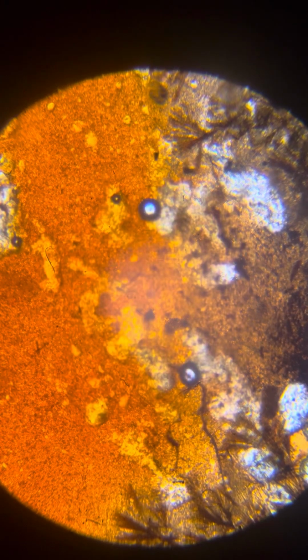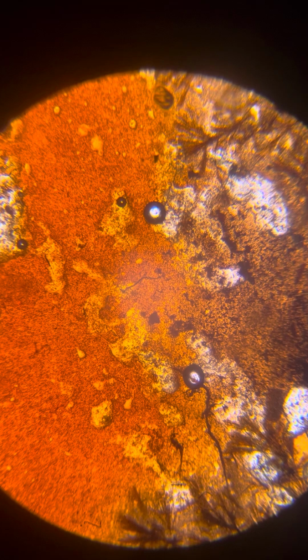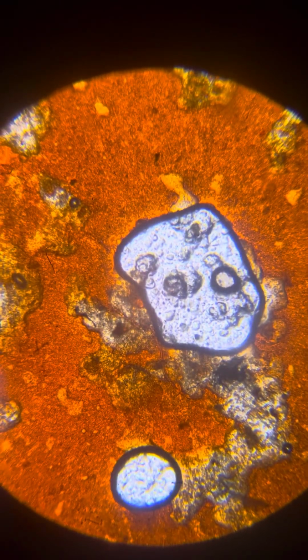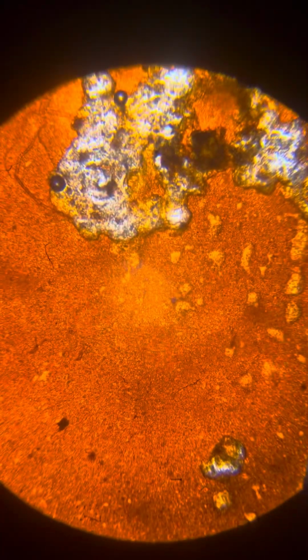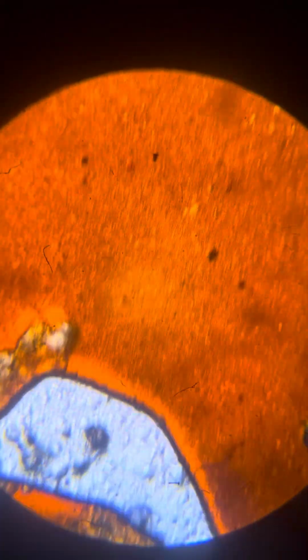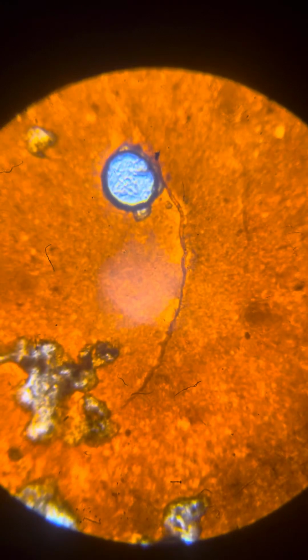Mutated yeast, very nice. You see it, Tenbacteria and Nero walking on it, very nice. As mentioned, they walk just by hovering above them. It's like a remote walking, but sometimes there is also mechanical friction between the bacteria and the Nero. Usually it's hovering above and watching and doing stuff remotely, but sometimes it's been observed that they actually touch each other, even vigorously, in a frictionless way. Here as well, you see something like that.